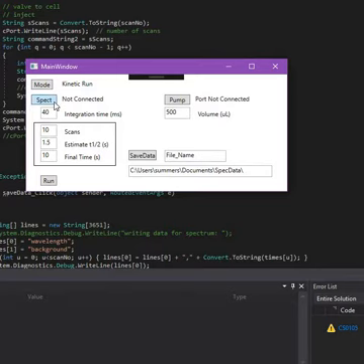First of all, we have to connect the spectrometer. You click on that button, and it takes a little bit of time, but it says connected to the Thorlabs CCS100 spectrometer. Then you hit the pump button, and we connect to our apparatus on communication port 4. We can change the volume of solution we add. We're going to add 600 microliters from each of the two syringes. We can change the number of scans. I guess 10 is probably good enough. We're going to estimate that the experiment will take about 4 seconds to run, and let's give it 25 seconds of total time.